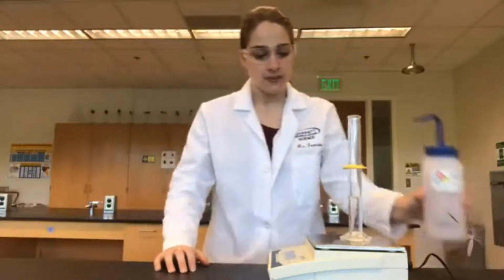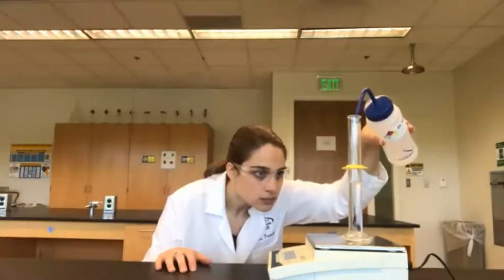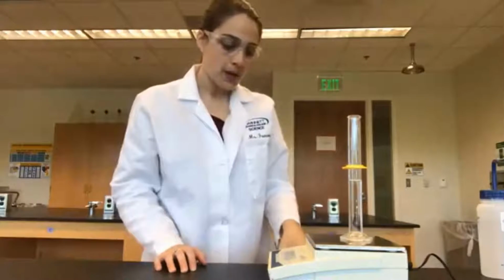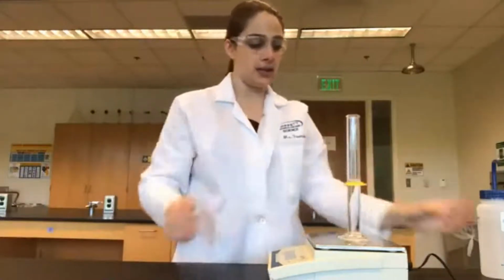Let's go up to 30. Okay. For 30 milliliters, we're at 125.58. We're going to go up to 40 milliliters.